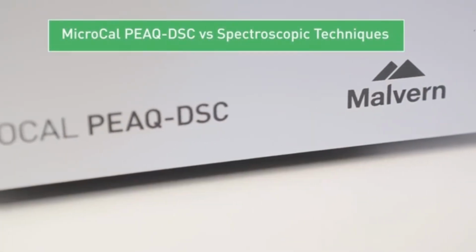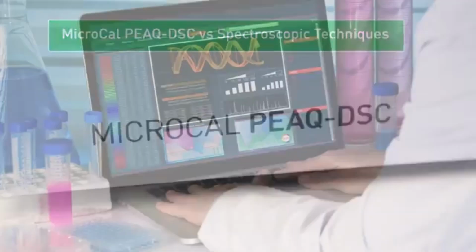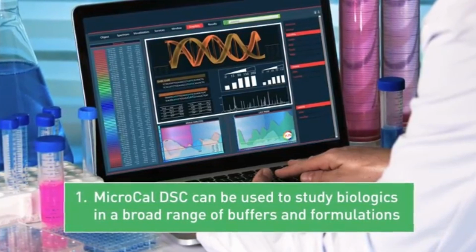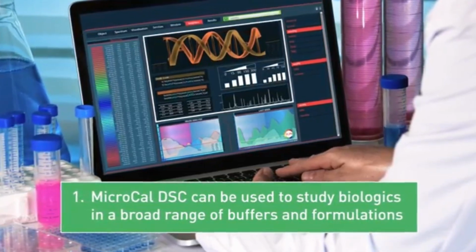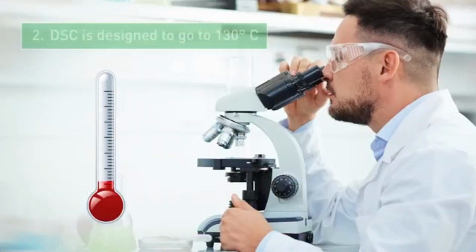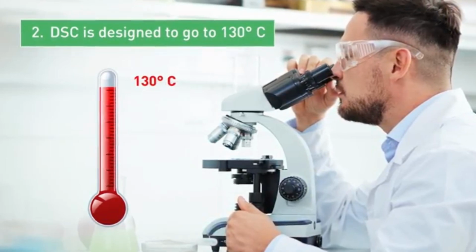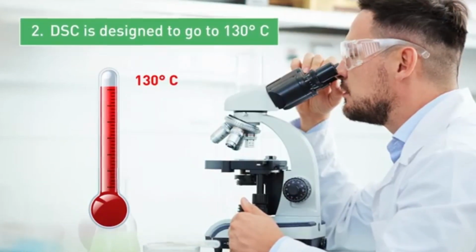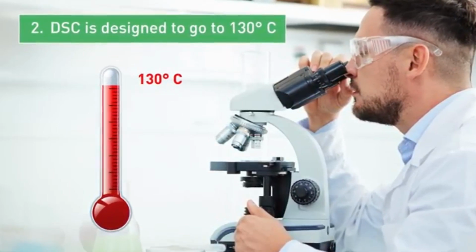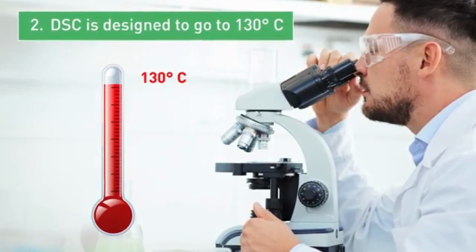There are a number of other advantages of DSC over spectroscopic techniques. Firstly, microcal DSC can be used to study biologics in a broad range of buffers and formulations, which can be a problem for many other techniques. Secondly, DSC is designed to go to 130 degrees Celsius. Many spectroscopic techniques cannot be used above about 90 degrees Celsius, which means that any highly stable proteins with Tms above about 75 degrees Celsius cannot be studied.